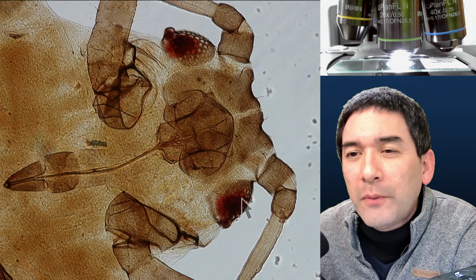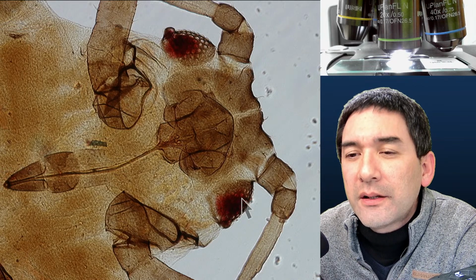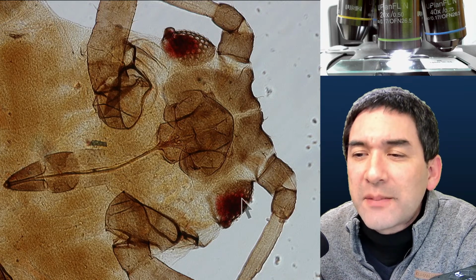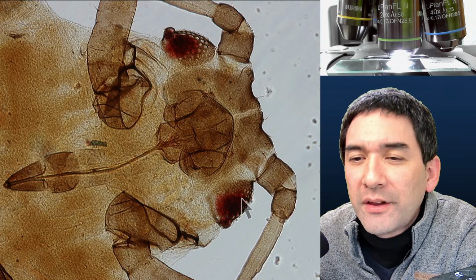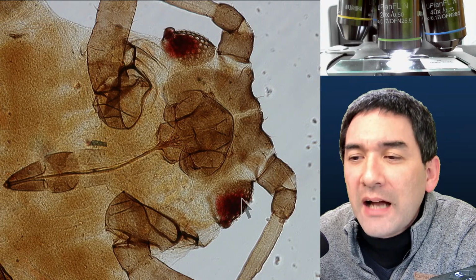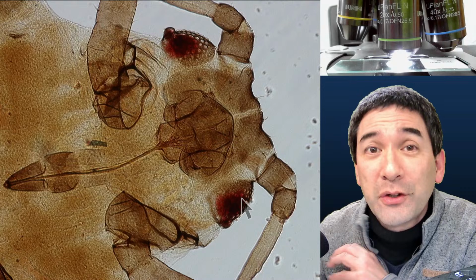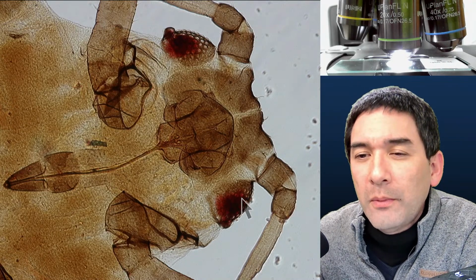There are already some questions over here, and there are some comments I would also like to read here in the chat section. "I had a great insect experience with my students this week. We viewed mosquito larvae under the scope and discovered they had hitchhiking epistylis. It looks like vorticella over much of the bodies." So that's also something that sometimes happens: larvae that have been in the water for quite some time have other microorganisms growing on them.